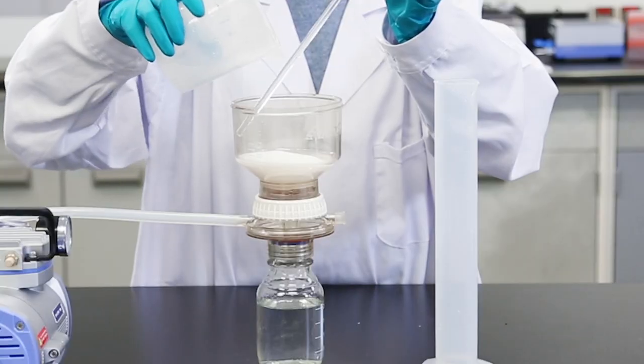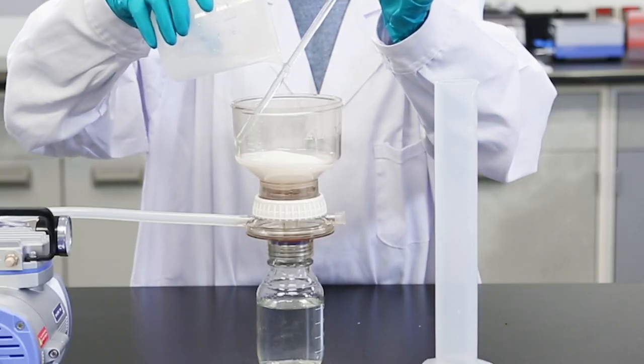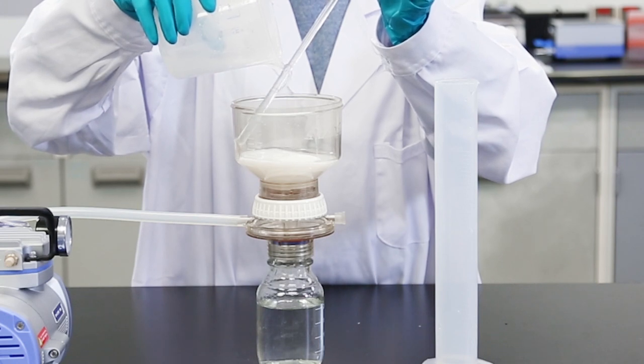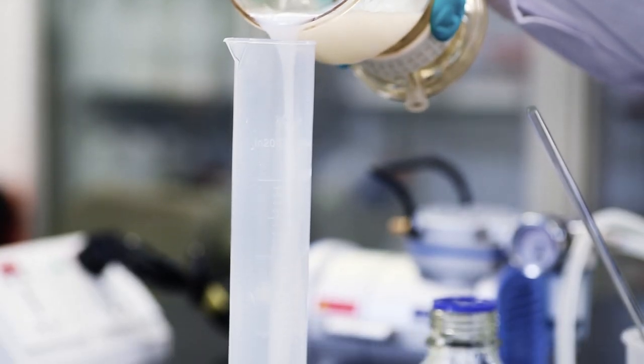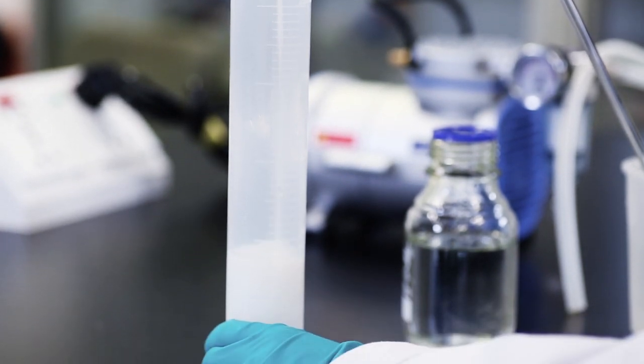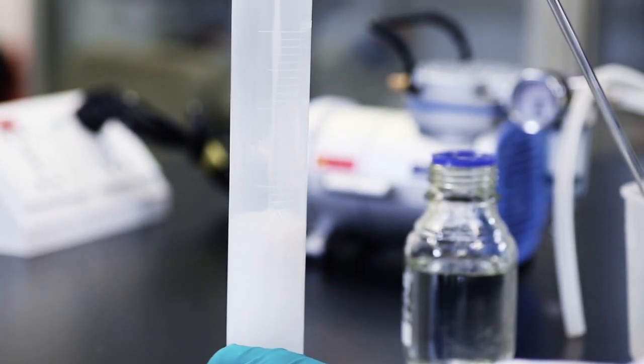Remove the liquid using vacuum and wash the resin at least three times with the recommended packing solution to ensure that all storage solution has been removed. Gently stir with a plastic spatula between washes.